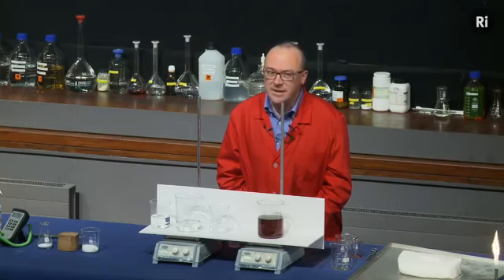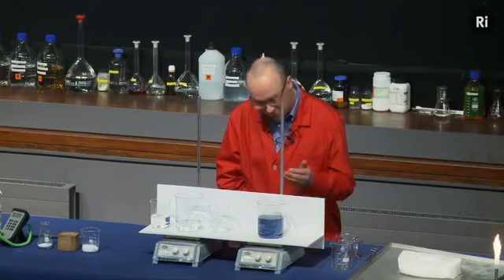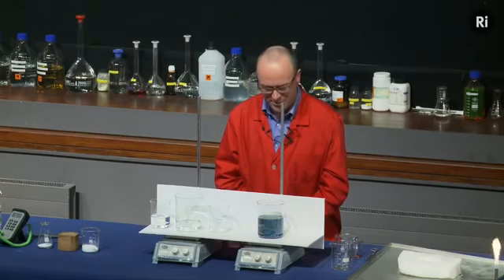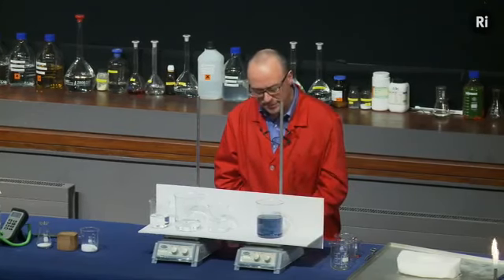And then about 10 years later, a student of chemistry, Anatol Zhabotinsky, a Russian student, discovered Belousov's notes. That's turned back to blue. That's turned green. All right. So remember that sequence. We were green for a little while, then blue, then it went red, then back to blue briefly, now it's green.